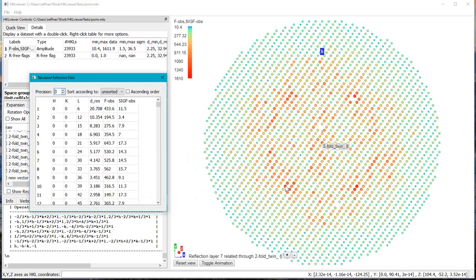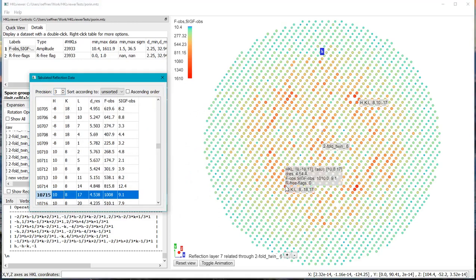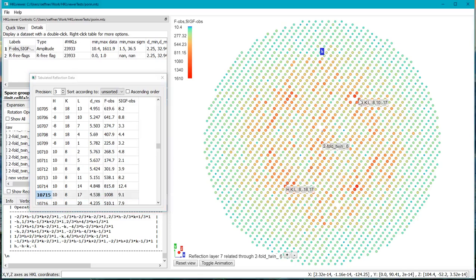and then right clicking one data point here, we find that the value here is 1008, and the twin related value we can find from a tooltip being 901. So that indicates that these two values here are within the same order of magnitude, and confirms that it's twin related.